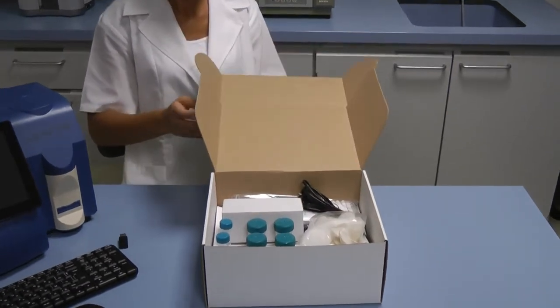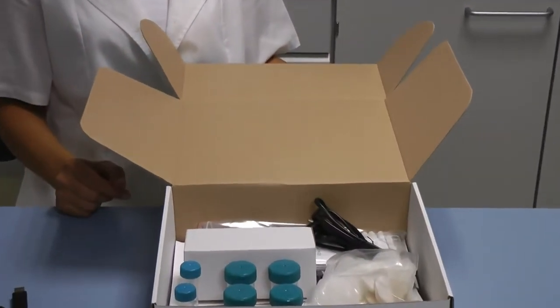Please make sure you have read the instruction manual before you start working with the device.